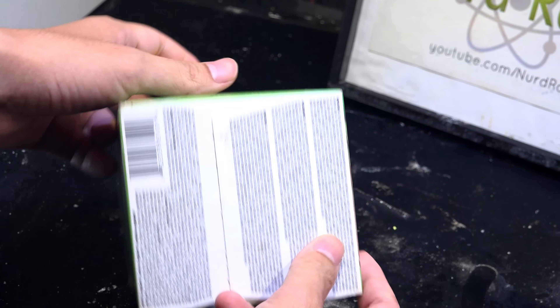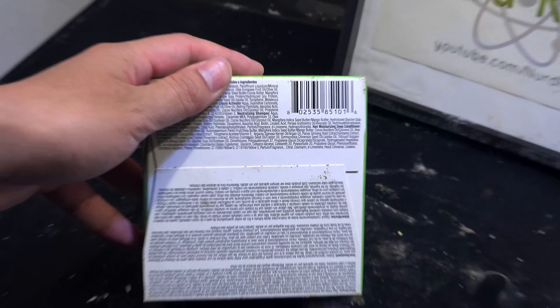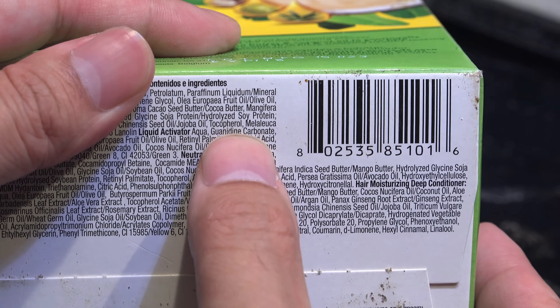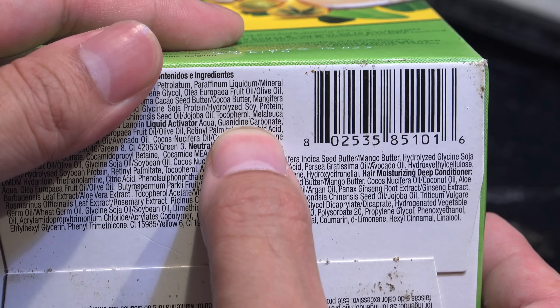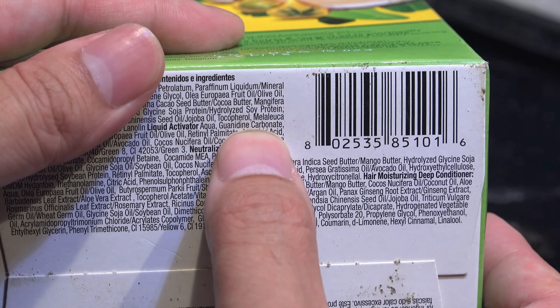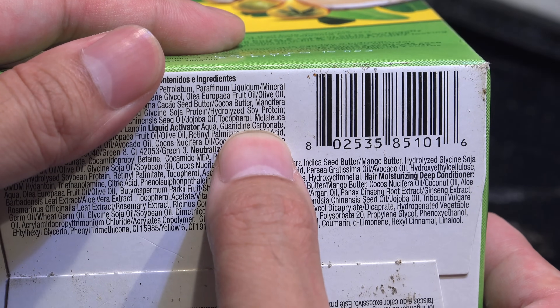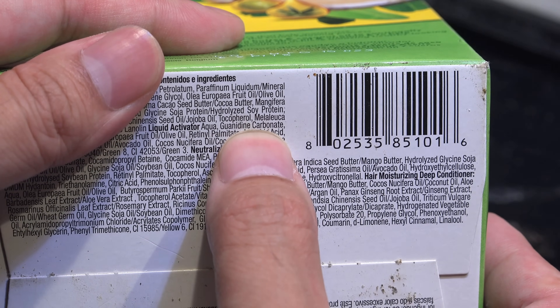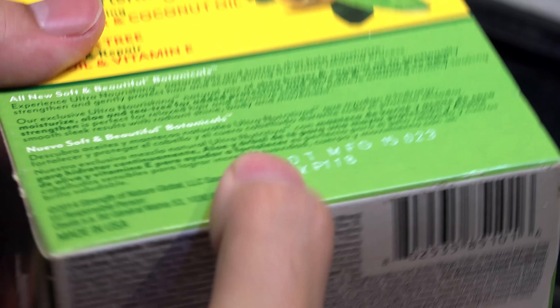To be sure, check the ingredients list — somewhere one of the components should be guanidine, usually in the form of guanidine carbonate. Now this also has plenty of other ingredients like dyes, surfactants, perfumes, and other oils, so we're going to have to run a few purification steps to get our guanidine.